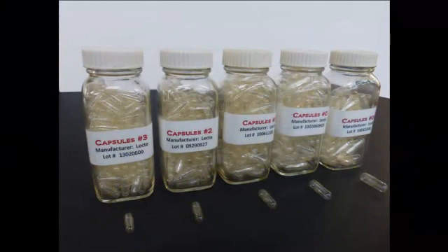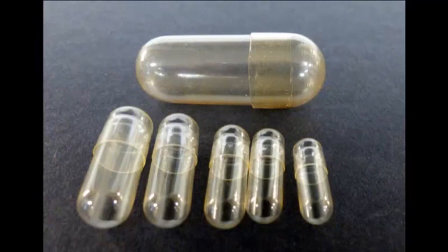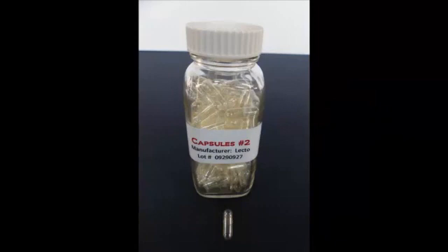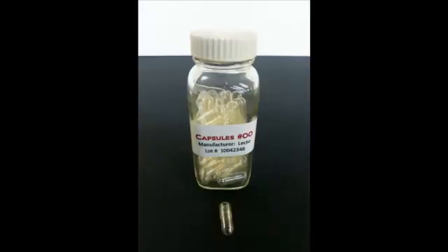Capsule sizes range from a 5, which is the smallest, to a 000, which is the largest and generally used for veterinary compounding. There are even larger capsules available which are only used for large animal dosing. The capsule sizes used in our laboratories will include 3, 2, 1, 0, and 00.